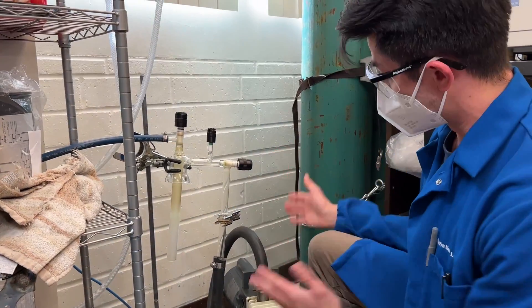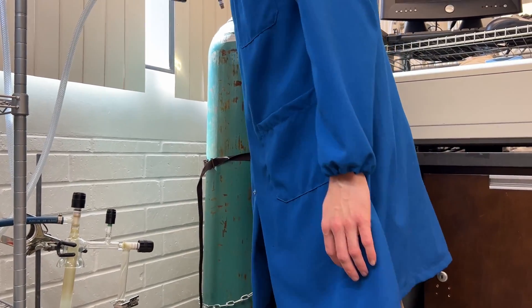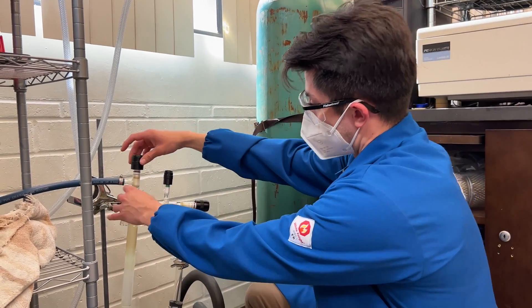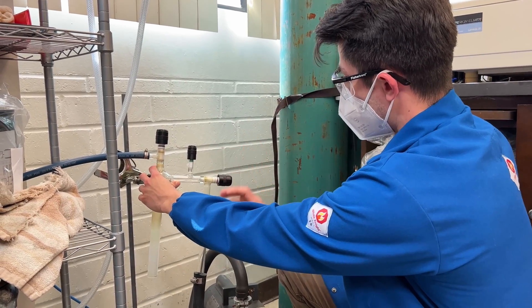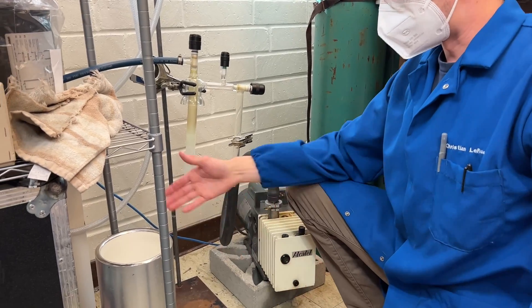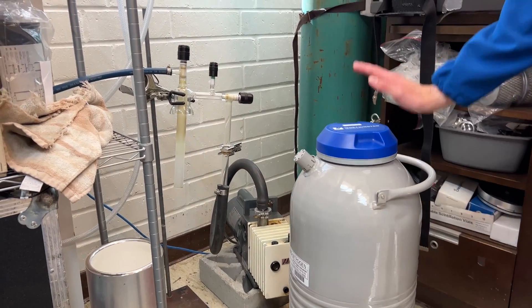It's fine that the pump is still running because the vacuum is contained to this one point. From here, you're going to go ahead and turn off your power switch. And just for good practice, righty-tighty all of them — especially your bleeding evacuation valve — close them all off.